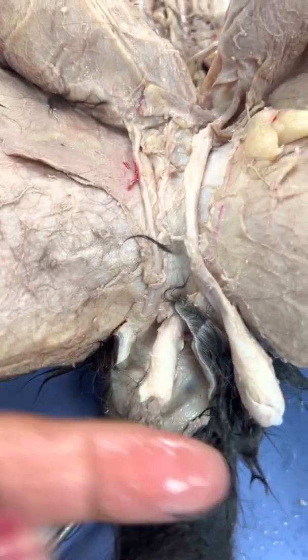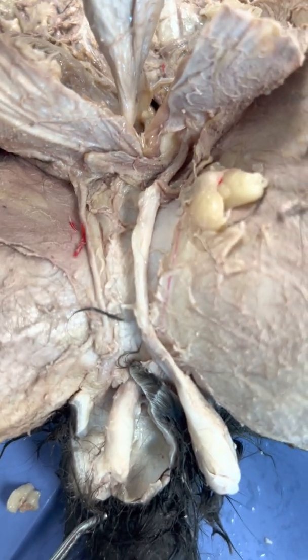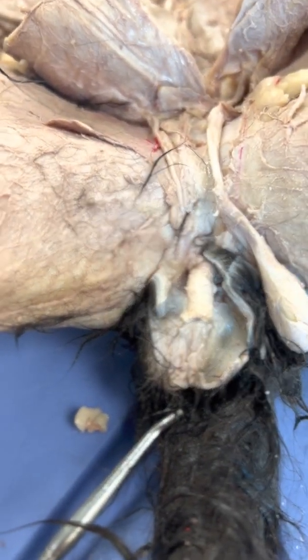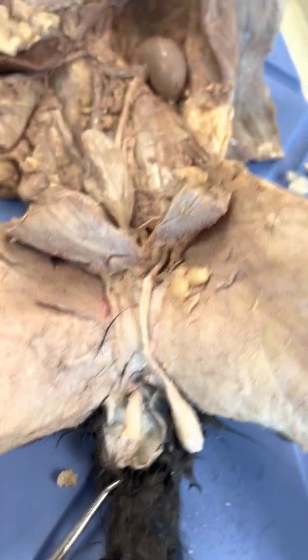And here's the deal, the bladder is way up here. So you know the urethra is traveling through all of this down through the end of the orifice, exiting the penis.